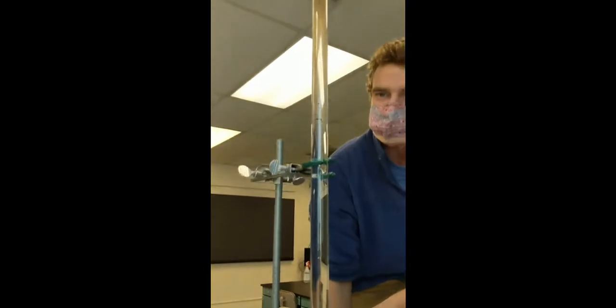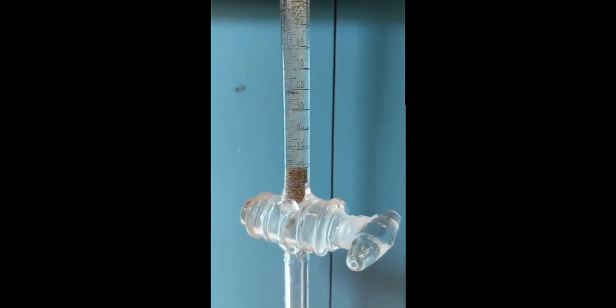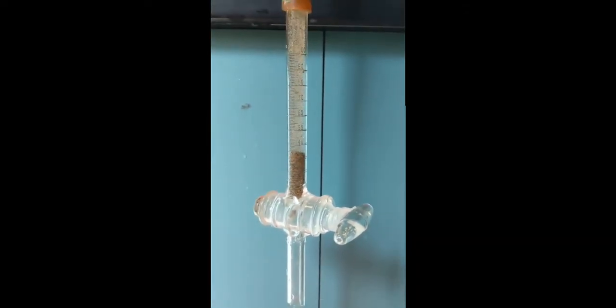All right, and there goes the sample going down. You can see it settling down through the tube. We are about to reach 13 seconds right there, and we have very little that's settled. And now we're about to reach 19 seconds. You can see we're accumulating some sediment down in there now, about a centimeter worth. And we're going to go to 40 seconds, so we're going to wait another 12 seconds or so. You can see the sediment accumulating.